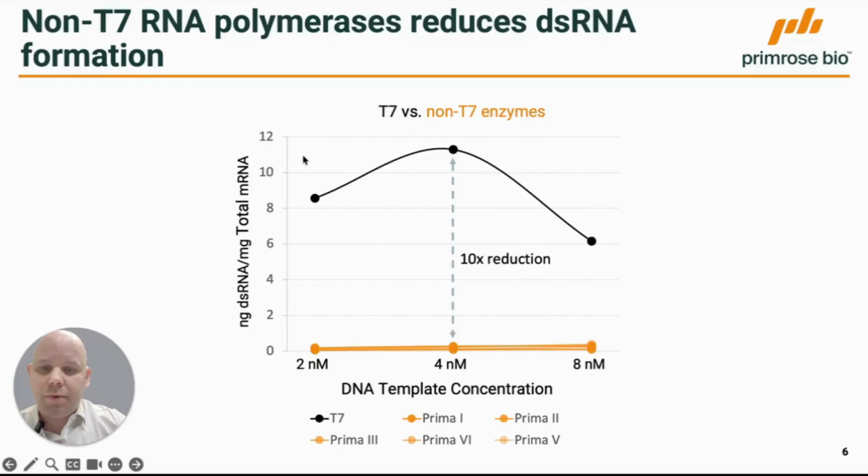Here we have an example where we measured double-stranded RNA per total mRNA generated by T7, in black. You can see we tested how much double-strand RNA is generated in different in vitro transcription reactions with different amounts of DNA template. There's quite a bit of double-strand RNA generated by T7, but with these non-T7 enzymes, in orange, that we work a lot with in our lab, regardless of the amount of DNA template, very little double-strand RNA is generated.